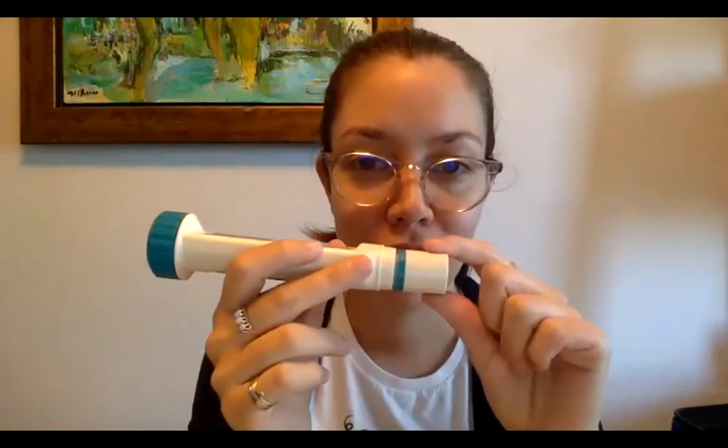The next thing to do, which is really important and people often forget, is that there's a cap here. You just want to pull, and you've got to pull pretty hard, especially when it's new, to reveal the little electrodes here, which are going to take our conductivity reading. Conductivity is going to help us measure all of the dissolved salts and solids in the water. I just have tap water for now, so we're just going to do the test here. I'm just pouring it in.